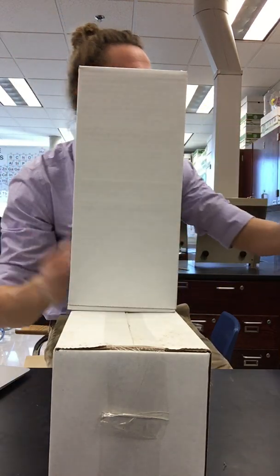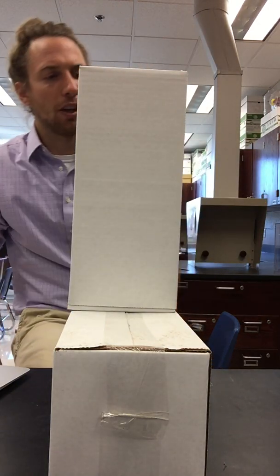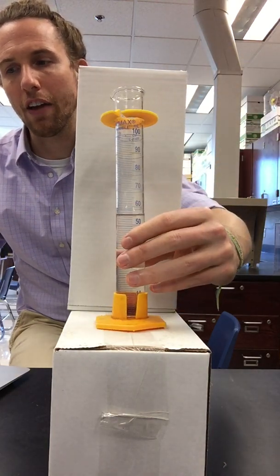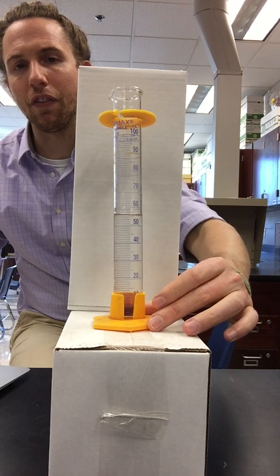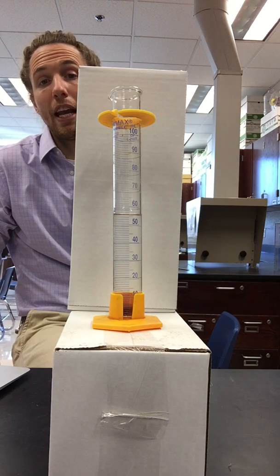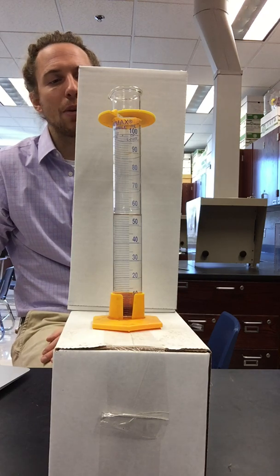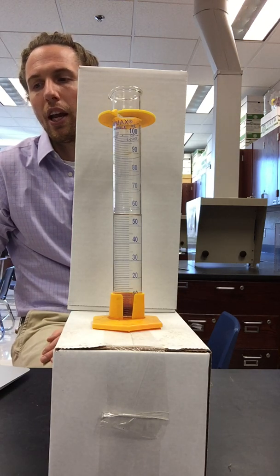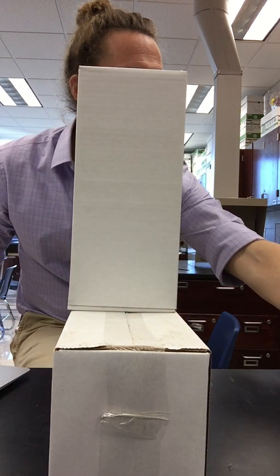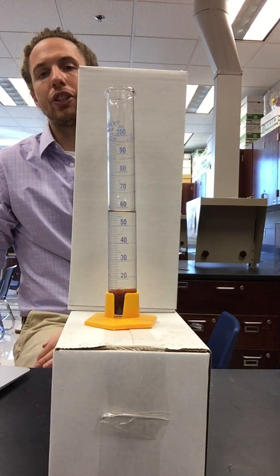All right, let's take it from the top. We're going to start with the iron(III) nitrate and sodium hydroxide reaction. And let's start with number 1. So this is the 5 to 55. Cylinder number 1, 5 to 55. If you have trouble seeing this, I recommend potentially pausing the video and zooming in. So you can pause whenever you need to. If I go too fast, just pause, and then you can come back and see what you've missed. So that's cylinder number 1. It is the 1 to 11 mole ratio. Here's cylinder number 2. This is the 1 to 5 mole ratio.